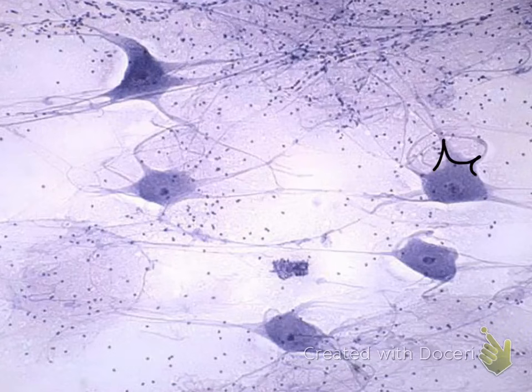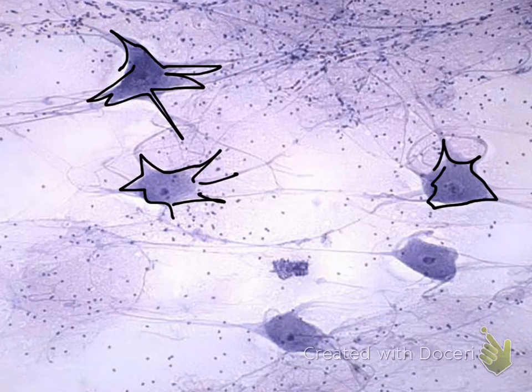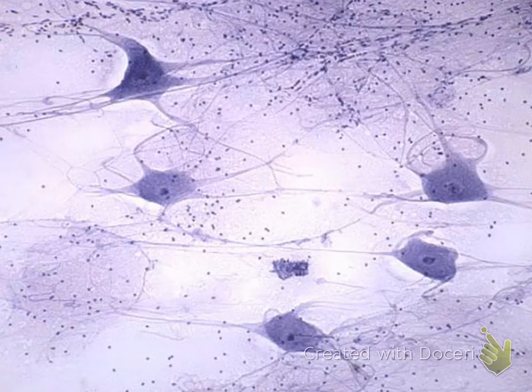Note the star-shaped looking cells. When you see star-shaped looking cells, then you are looking at neuron. So therefore, this is the nerve tissue. Features of the neuron, remember these branches coming off, those are your dendrites. The longest branch coming off is your axon. The main portion is called the cell body, and the dark structure in the middle is your nucleus. All of these tiny little dots that you see everywhere, those are your neuroglial cells, the supporting cells.